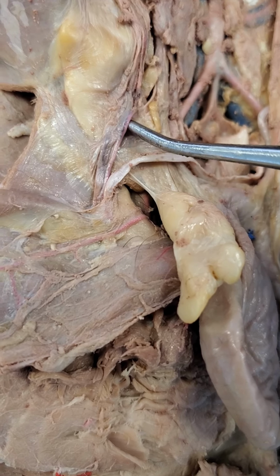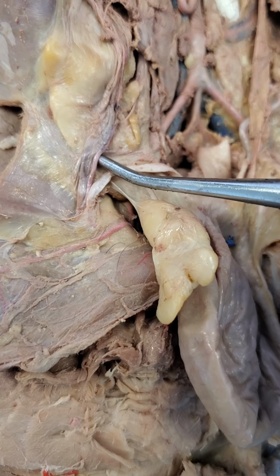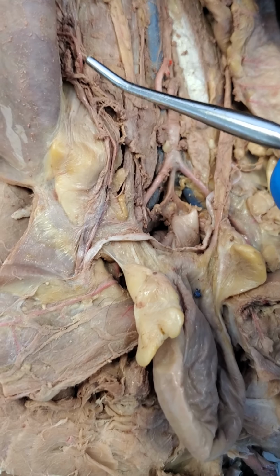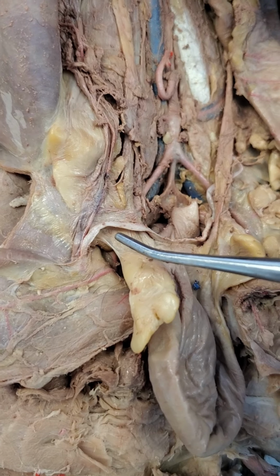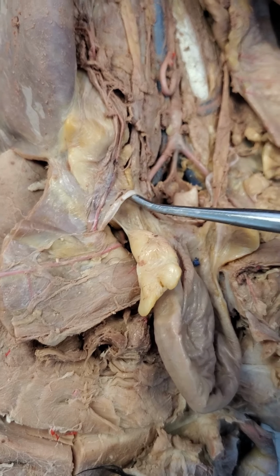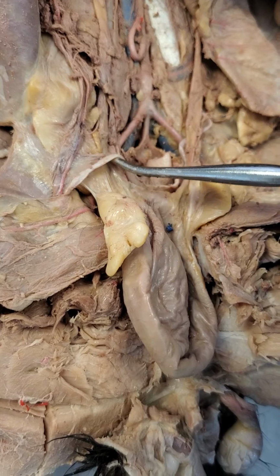And you can see the spermatic artery just continues to run upwards. So all of those, the spermatic vein, spermatic artery, and the nerves, continue to run upwards along this tract here. But you can see the vas deferens branches out, and this again was a structure that we mentioned that loops behind the bladder. So this is all the vas deferens. And in humans, this is a structure that's actually severed during a vasectomy.